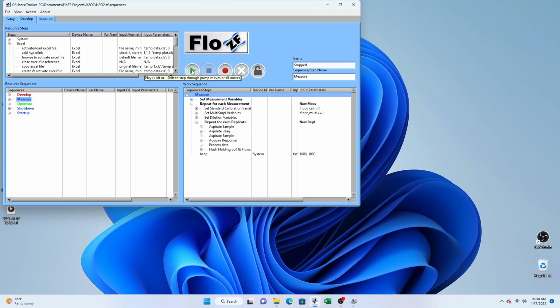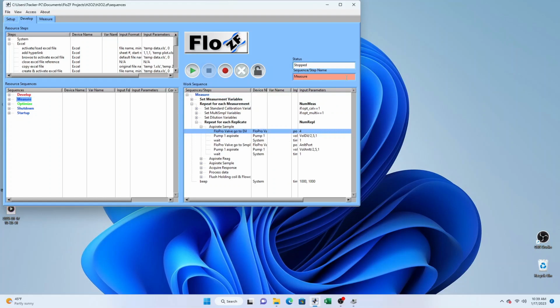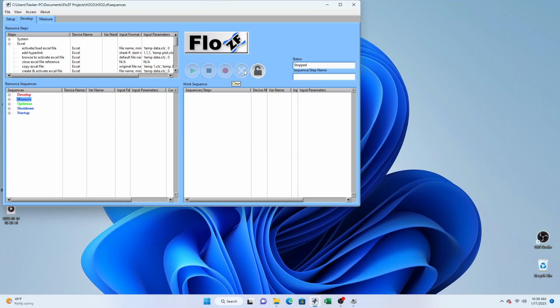To run the sequence, we press the green arrow. If we need to pause the sequence for any reason, we press that again, and then when we want it to go, we press it a third time, and the sequence will continue either where we have positioned the cursor or at the point at which we paused it. The second button stops the sequence when it is running. The third button records the sequence. Any change that we make to the sequence will result in this field changing color, so we know that some change has been made that has not been recorded back into our resource sequences. If we don't want to keep the change, of course we don't record it, but if that is a change we want to keep, then the record button is used. The X button clears the work sequence from the work sequence panel.